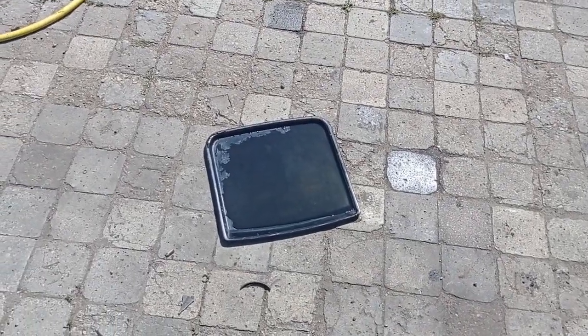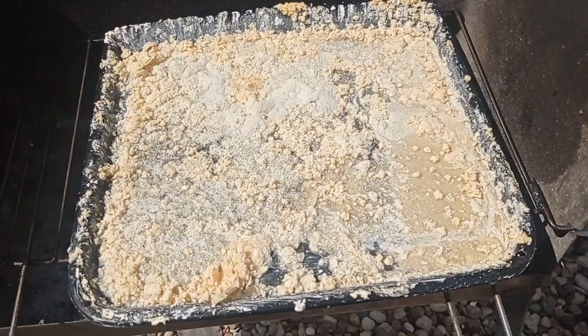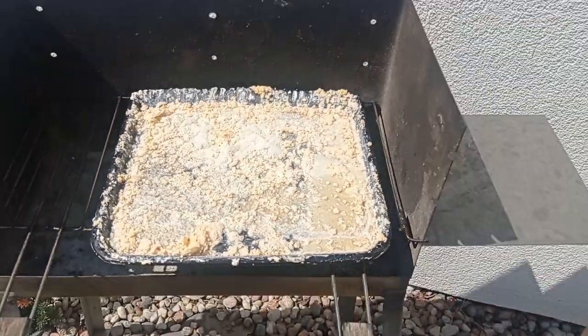I can start the evaporation process. It took me four days, but after a long time I finally had my dry crystals.